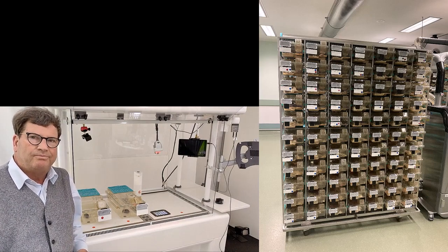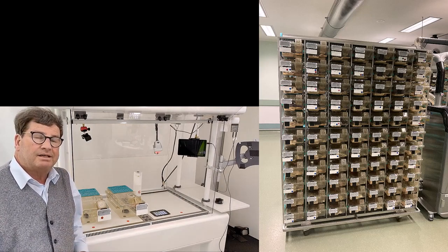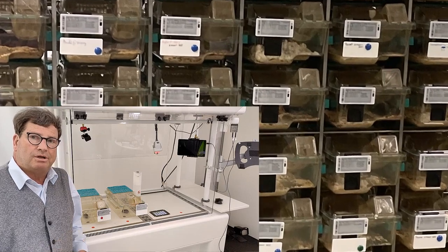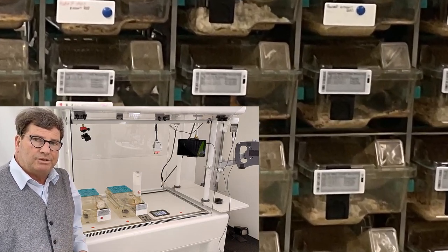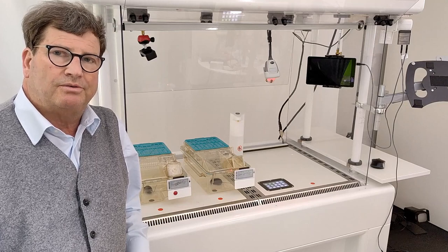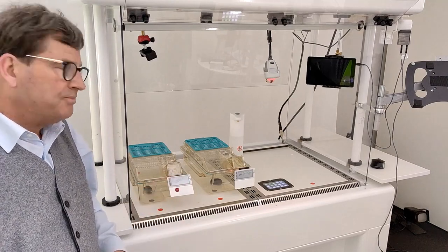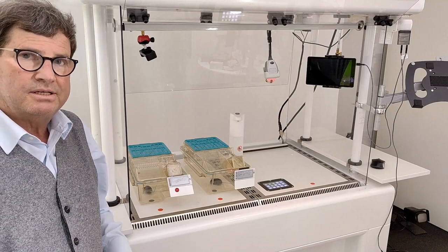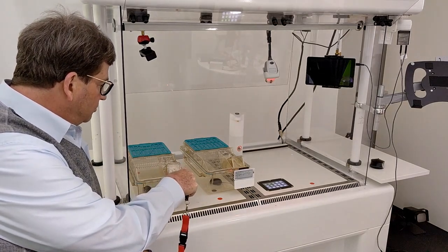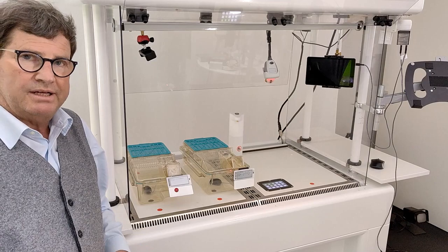To finalize this demo, I want to show you a rack in production. You can see that it looks extremely neat and clean. The customers put little notes to the long lids and use the buttons extensively. What I forgot to tell you in one of my previous explanations is that each Cage Talker label has not only one page but 3 pages. And with such a little infrared device, you can switch those pages. And now you see I'm switching that page. After a definable time, it switches back to the first page.